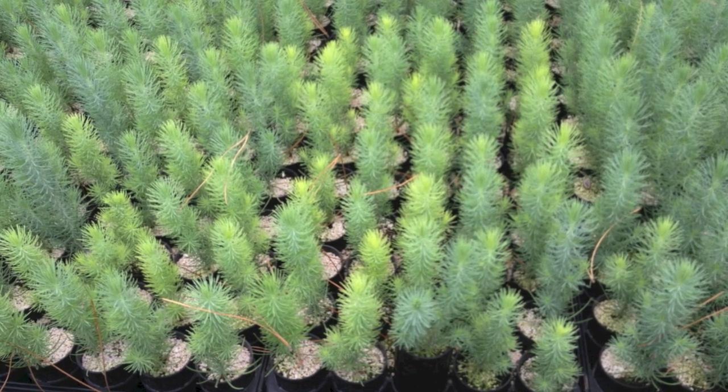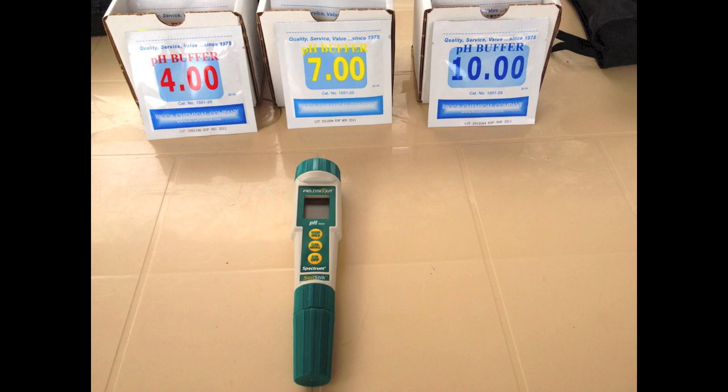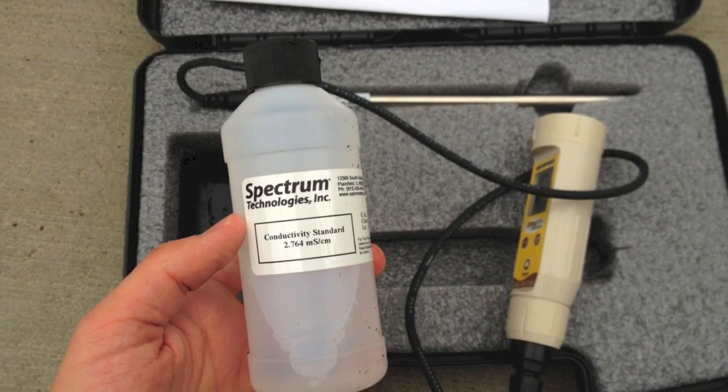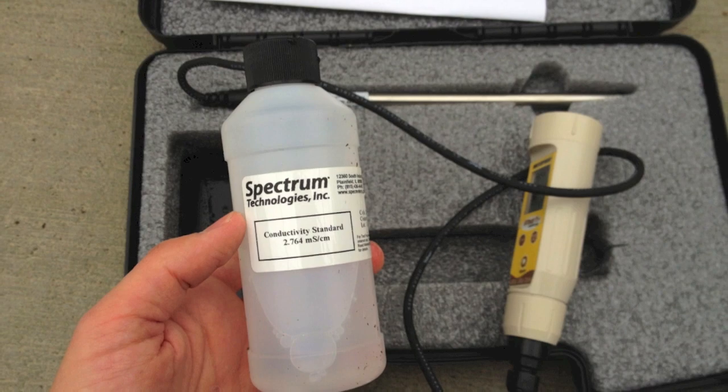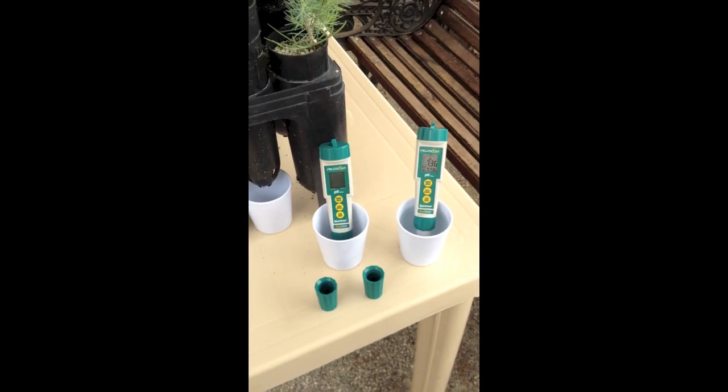Begin by calibrating your instruments. For a pH meter, use at least two buffer solutions. For the EC meter, use the standard solution provided. Follow the directions provided with your units carefully.